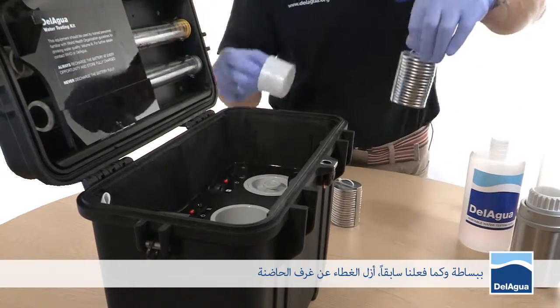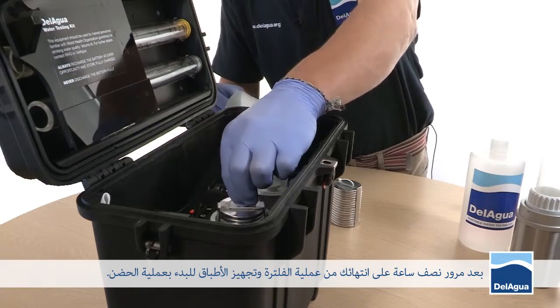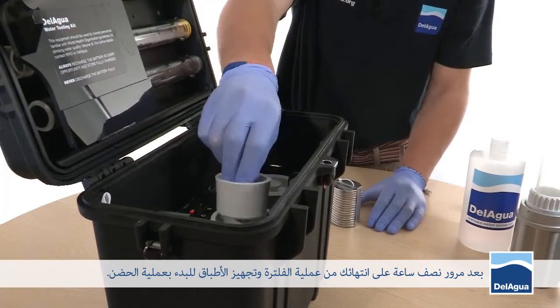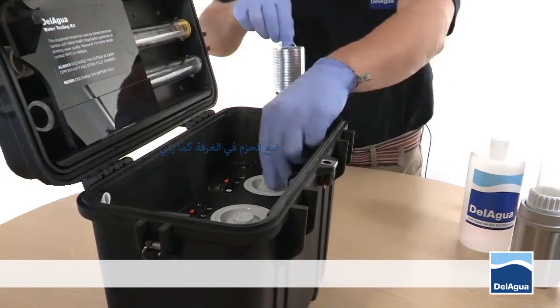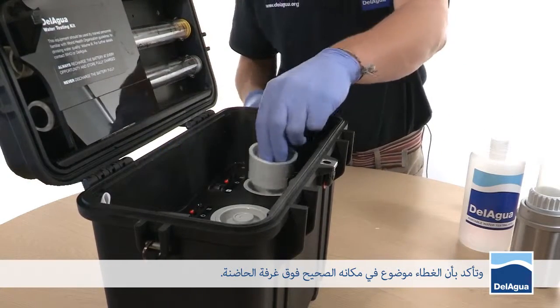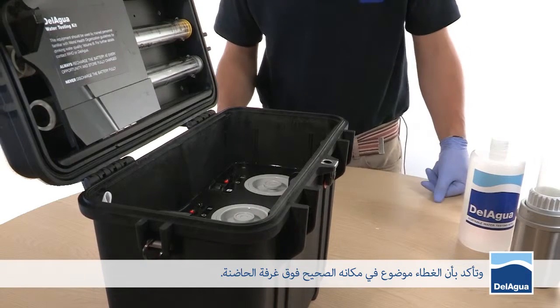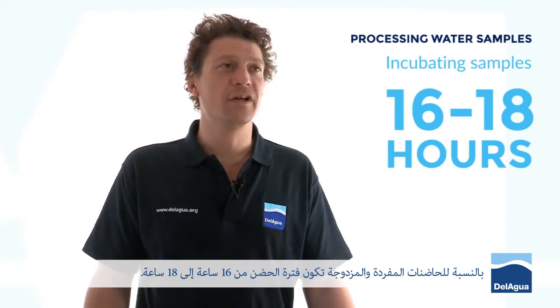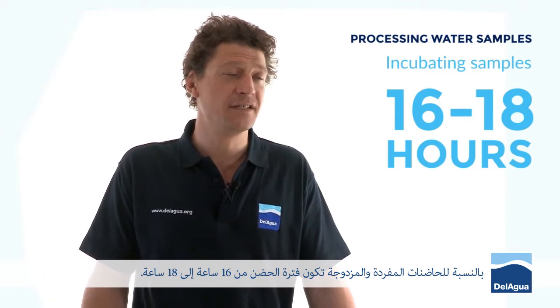Remove the lid from the incubator, ensuring there's been half an hour's rest between processing of the last sample and the start of the incubation period. Place inside the incubation chamber, ensuring that the lid fits neatly back on top. How long would you incubate for, for both the single and the dual incubator units? The incubation period should be 16 to 18 hours.